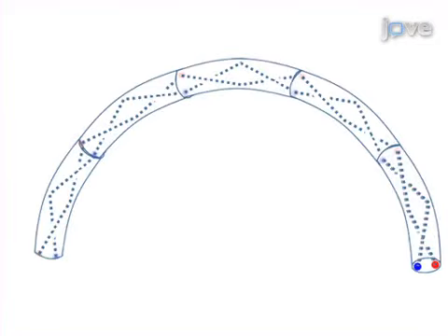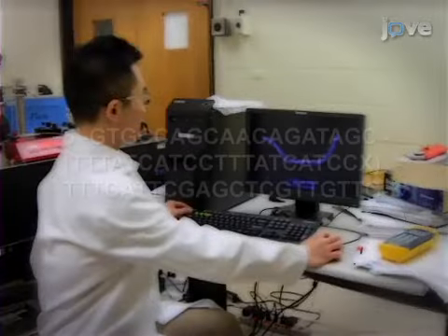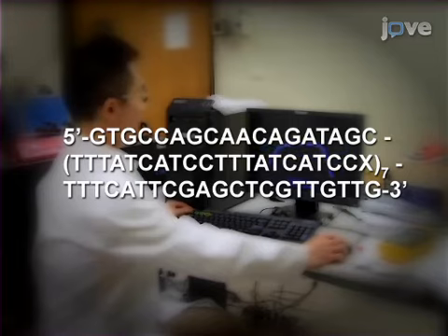Begin by designing globally curved DNAs by repeating a 10-mer sequence. For example, this representative sequence is a 186 base pair curved DNA, where X is a random extra base, and the sequences flanking the repeating 10-mer sequence are adapter sequences.